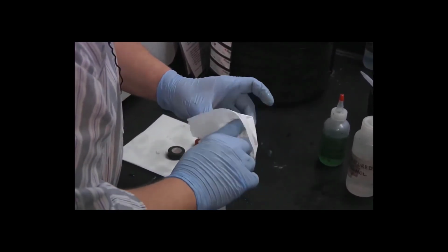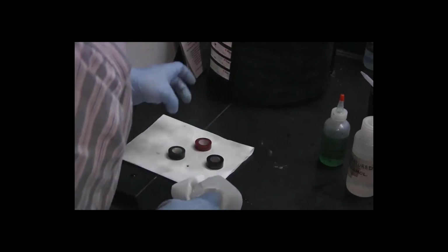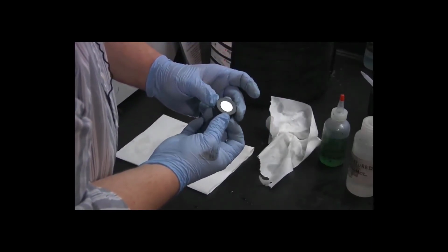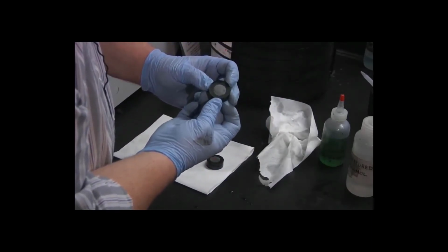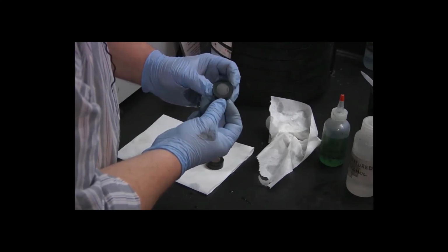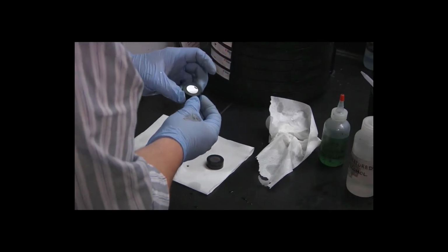Don't want to rub too hard on the surface of the metal, even though we're still in the grinding stage. And the only one I was concerned about was the green one, and this surface looks significantly better now. I can still see some large scratches, but it's much better than it was before. So I think we're okay to move forward.